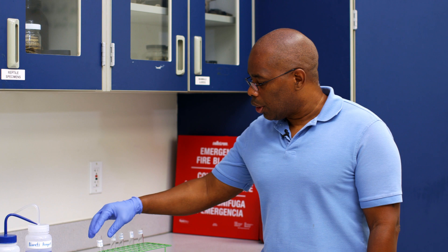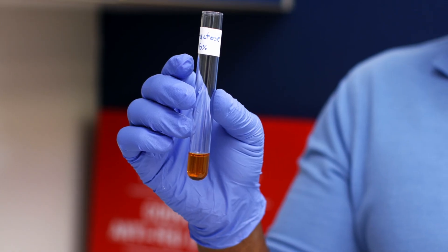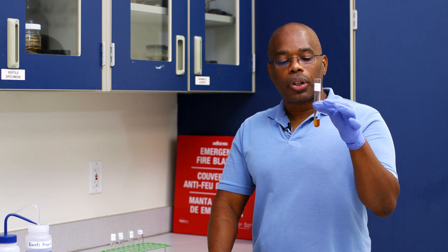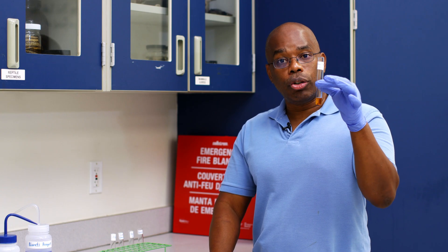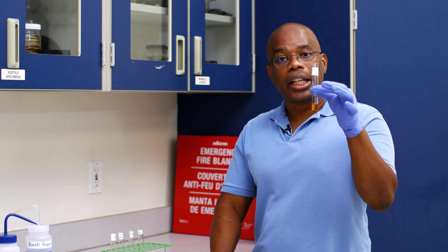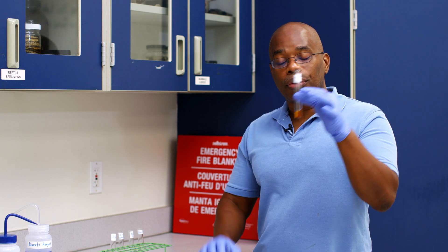Let's look at the results of our solutions. First we have fructose. We previously identified that this is a sugar. As we can see, although we get a color change in fructose, it does not give us the light purple lavender color. Therefore, this is a negative control — protein is not present in this solution.